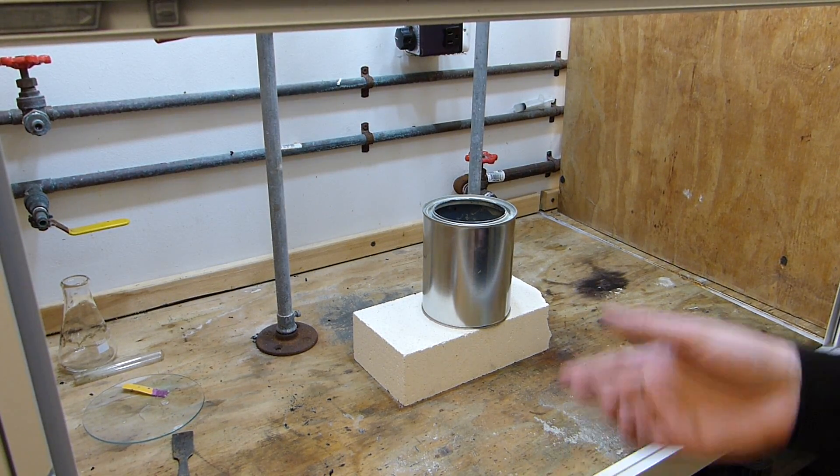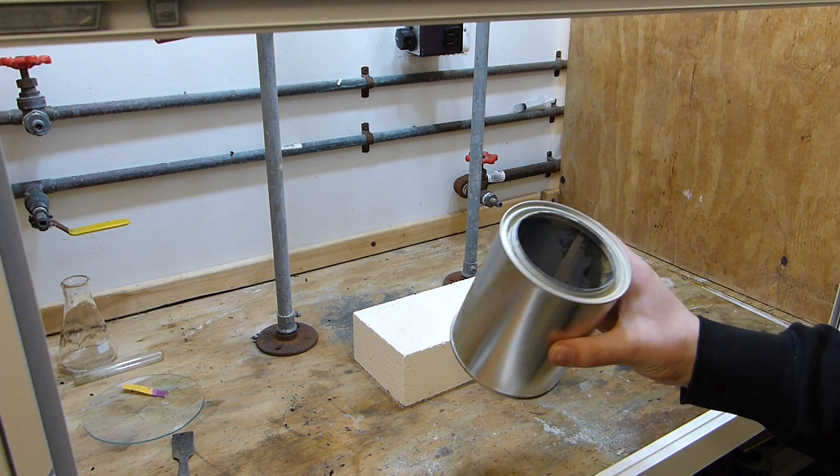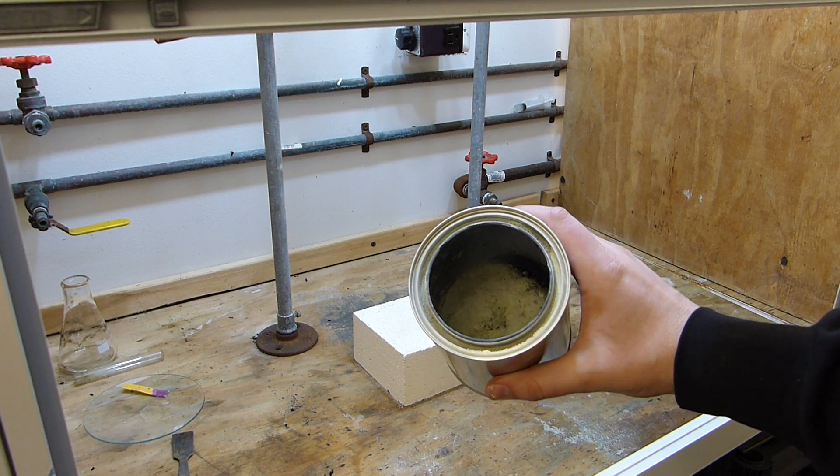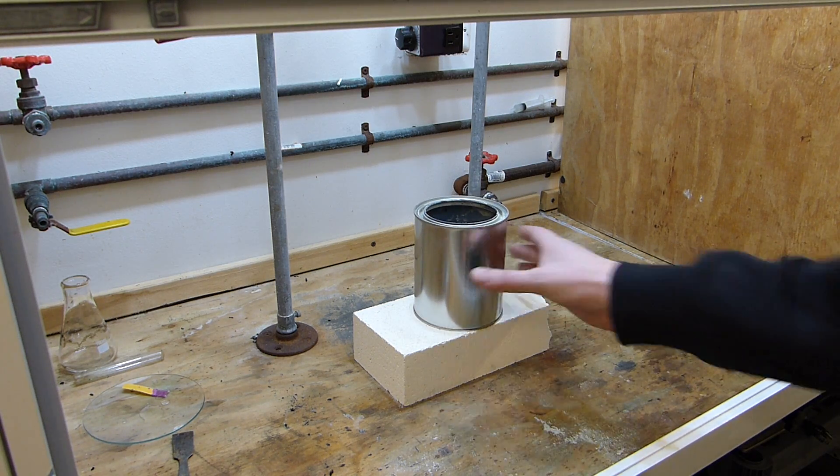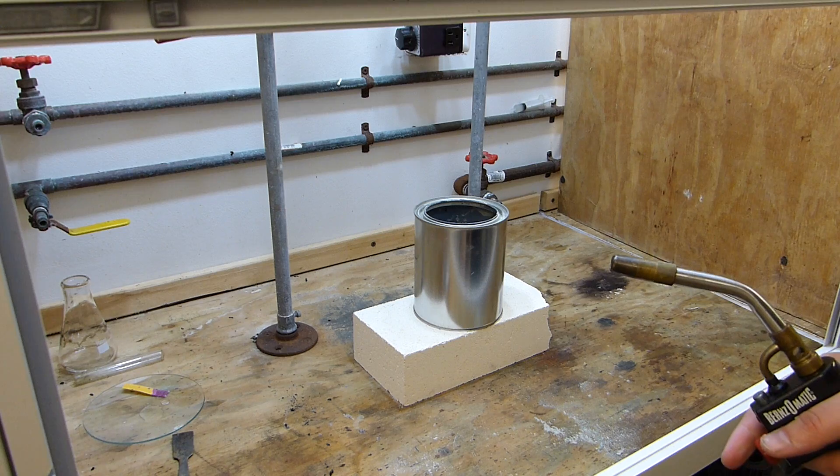I'll leave it up for now. You can see how efficiently that smoke is getting extracted. Okay so unfortunately the fuse did not light the mixture. It looks like it kind of fell out of the mixture and sort of zoomed around inside there rather than actually lighting it. So I'm going to do this the old-fashioned way and just hit it with the old propane torch.